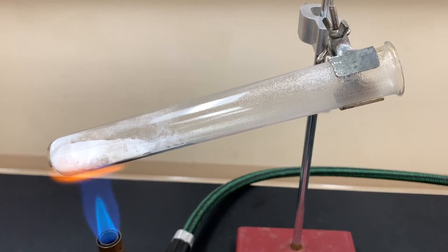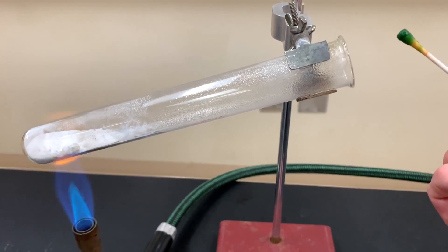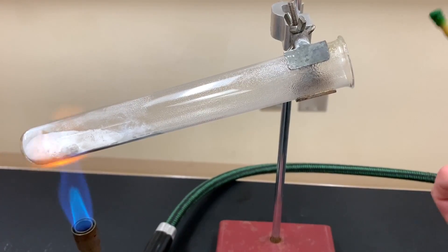The next thing I'm going to do is do the universal indicator test which is where if carbon dioxide is present it will react with the water in the universal indicator and it'll turn red. So again keep universal indicator away from your flame, just take your Q-tip or whatever you're going to use. I just have it soaked in the universal indicator which is green at this case to say neutral.